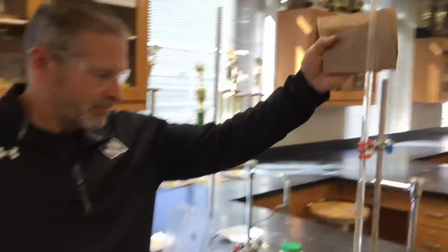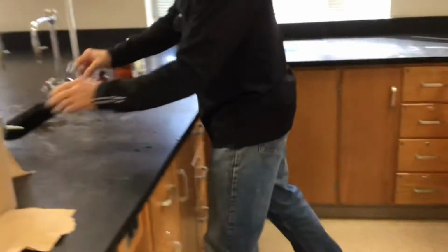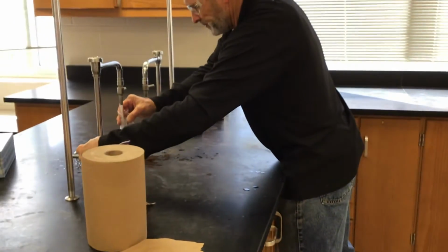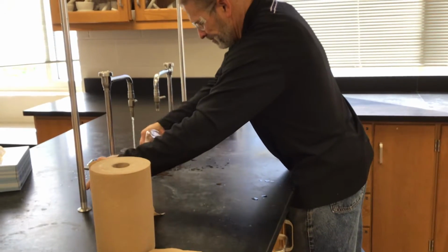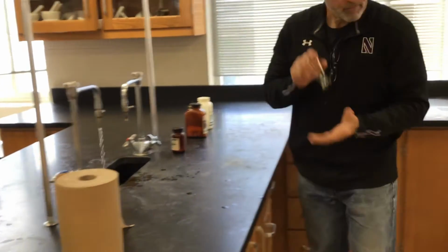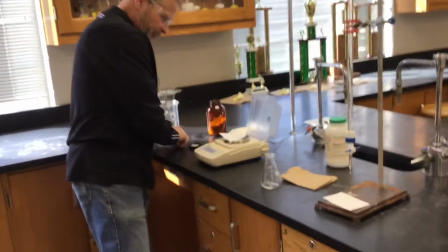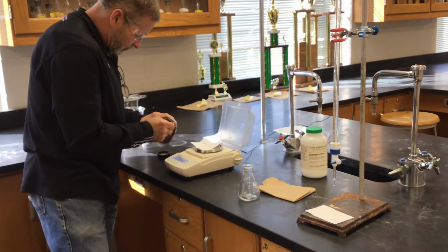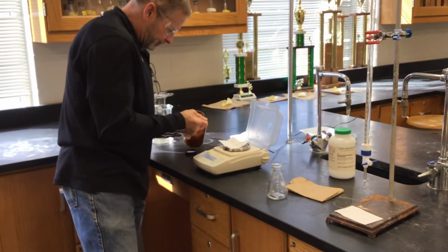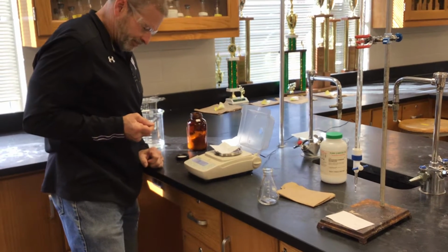Okay, Mr. Hevel, try one more. Yep, let's see if we can do it. Oops, too much.